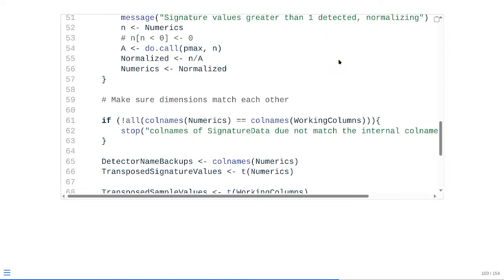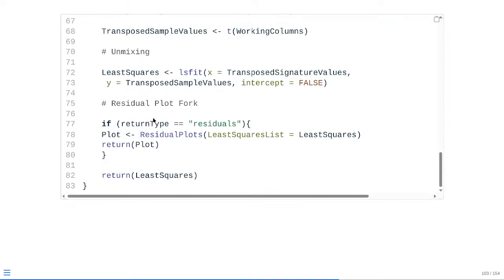And then at that point, as we scroll down where we had been returning the residual plots just as an individual line, we're now wrapping those within a conditional statement, basically saying if the return type is equal to residuals, it will go in, run the residuals to get them as a plot, and then it will just short circuit the function, returning the plot directly to us in our working environment. And if the return type is not set to residuals, if it's set to FCS, it's not going to evaluate this conditional, and it's going to continue down with the unmixing process to give us back eventually our FCS file.